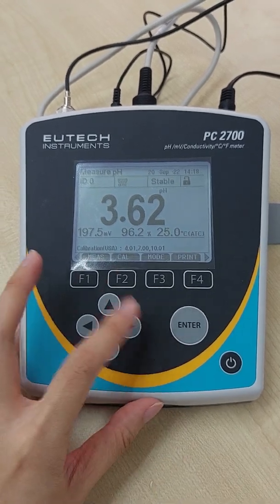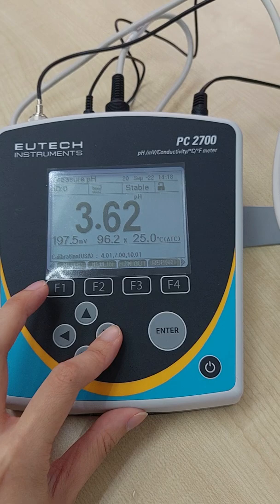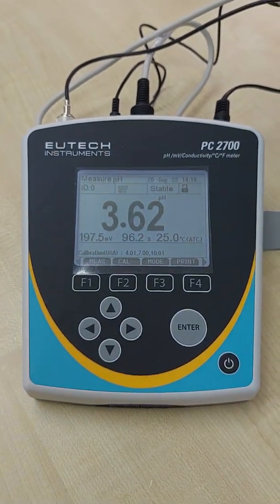I think that is basically the maintenance and operation of PC 2700. Great. Thank you.